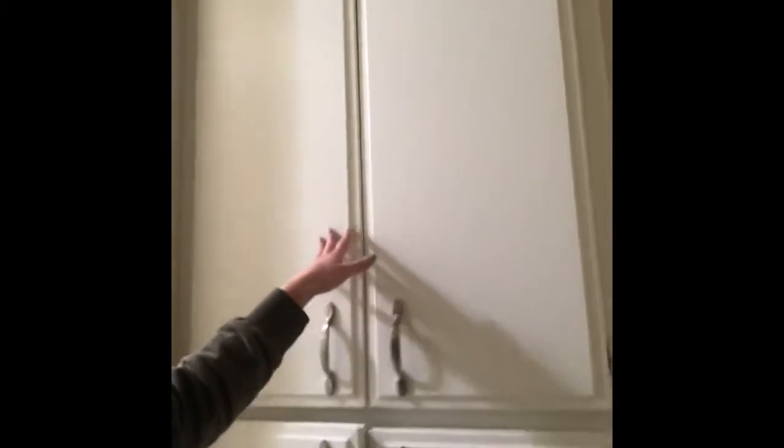Okay, so I am at my third location for an incubation spot that I have considered. Here in my hallway I have cabinets. So there's 4 cabinets right here that might be great for incubation. I did put my thermometer in there and it is just at 20 degrees Celsius, so it's a little lower than I wanted it to be. But I did consider this because it's a great location.